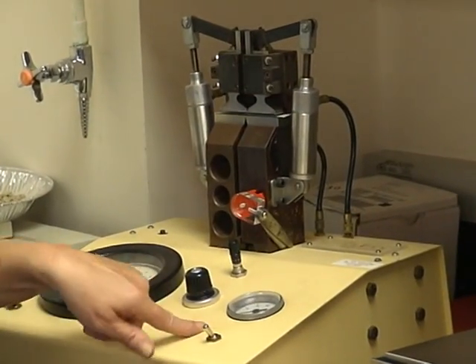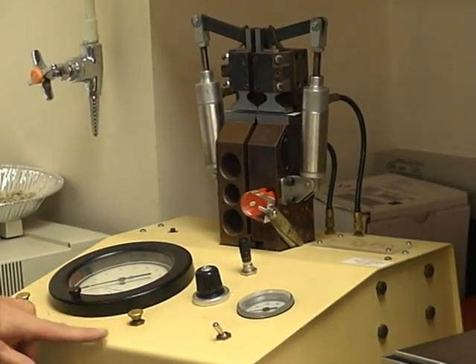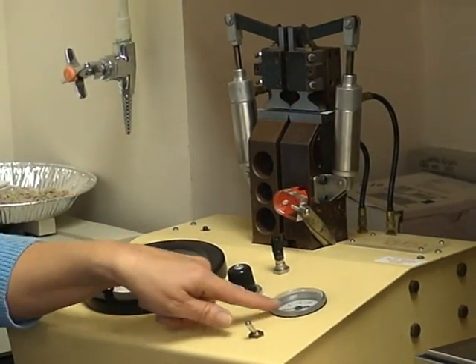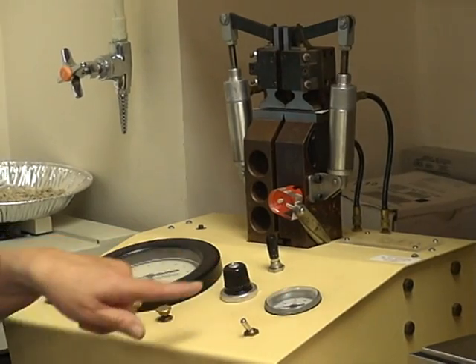And we have different buttons and switches here. This switch lowers our clamps and will bring our pressure up to around 60 psi.